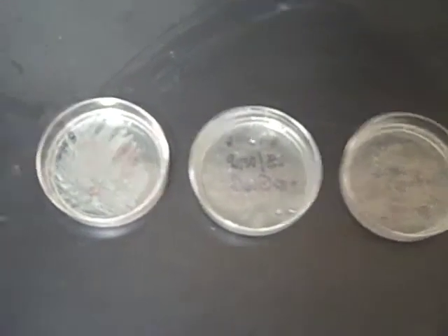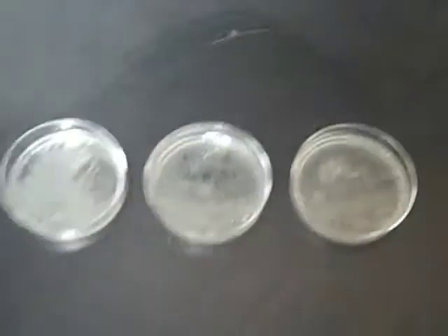Those are all 3 of our plates. And I tried to close up here. The camera I'm using is just a little flip camera, and the resolution's pretty poor, so I'm going to have to explain what's going on here. But what we see on that first plate is just a mat of bacteria. In the second plate, you see a lot of air bubbles in the gel because we had a rough time pouring the gel, but there's a few little spots there of actual growing bacteria. And finally, in the last plate, you also see some spots of growing bacteria, but it's not a mat, because most of them have been killed because there's antibiotic in those 2 plates.